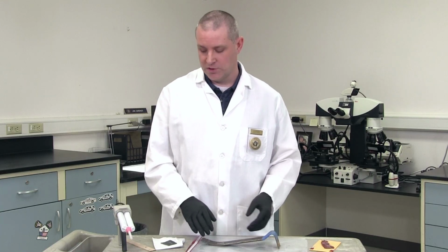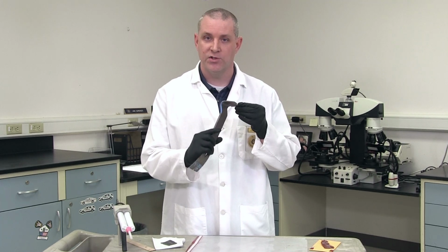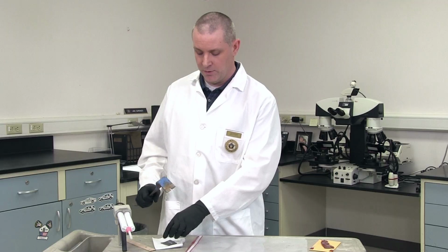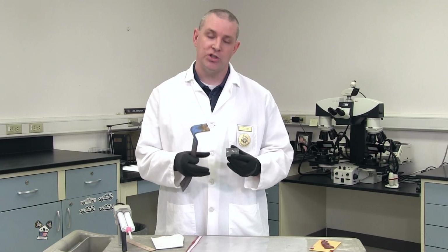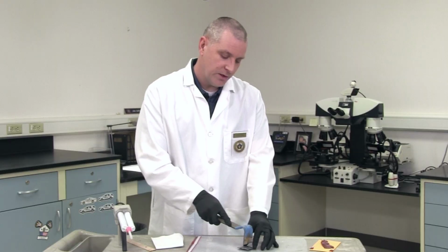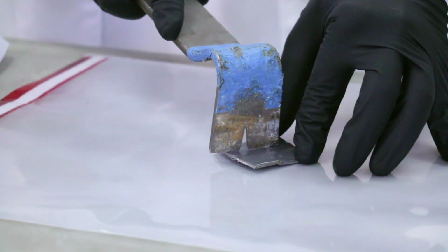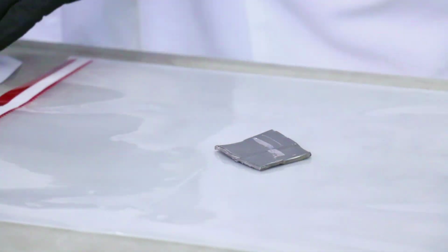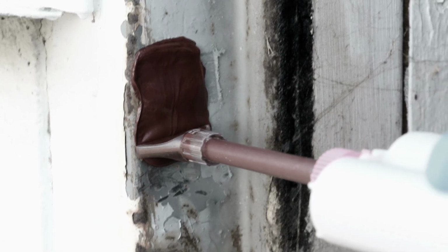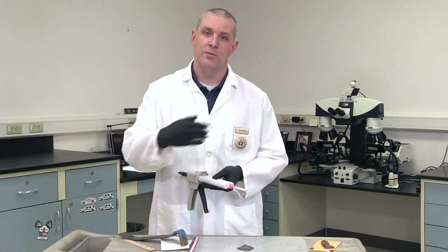So the first thing that I would do is make an impression of the unique markings from this tool. And I do that using a material called lead. We use a lead sheet and make marks of those imperfections on the blade. So what I would do is drag the blade across the lead and it'll leave those marks. So then what we would do is make a cast using that same red material to see if we can get those marks that come up on that material, and then we can bring them over to the microscope.